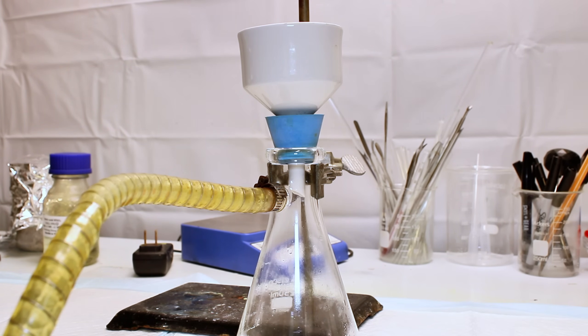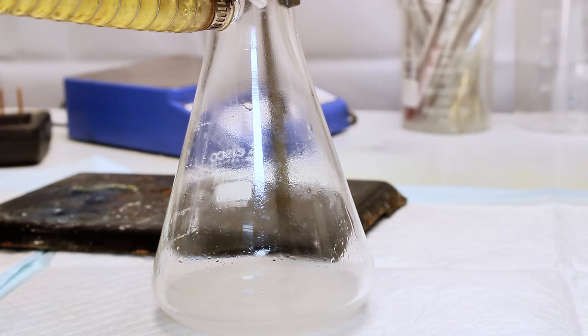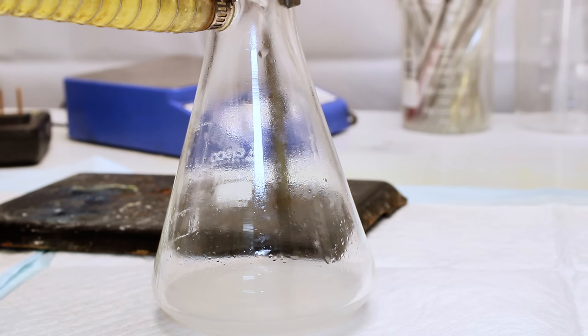This didn't happen when I made sodium aluminate in the exact same manner, so maybe the potassium version is just a lot less soluble. I'm not entirely sure. Regardless, I simply passed this all through vacuum filtration to obtain a clear solution of pure potassium aluminate.